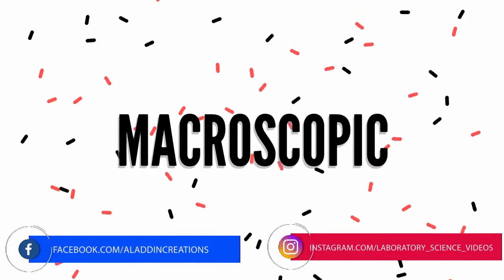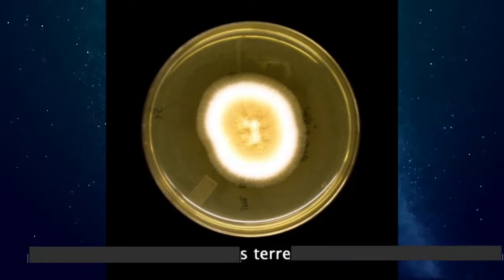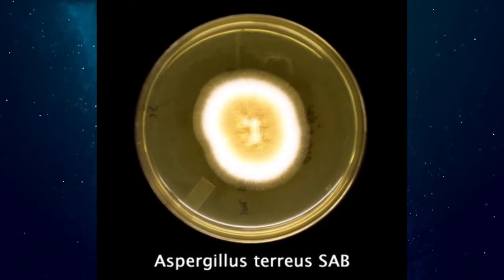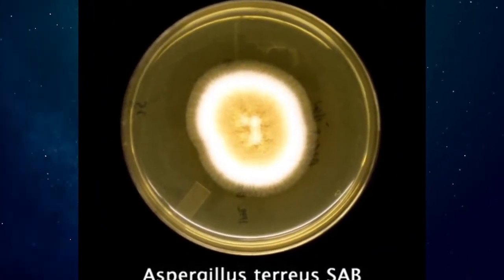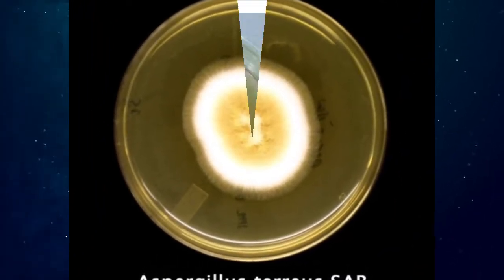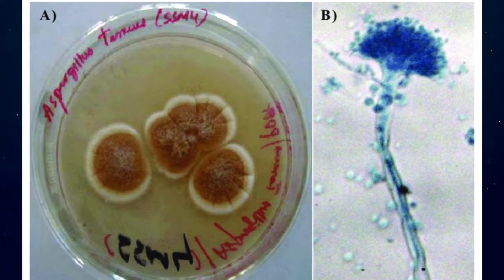Macroscopic Characteristics: Usually velvety, cinnamon brown in color. Reverse is white to brown color.